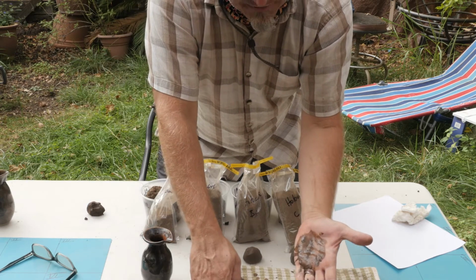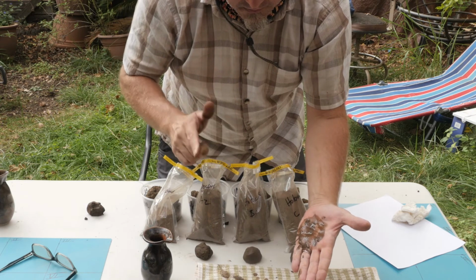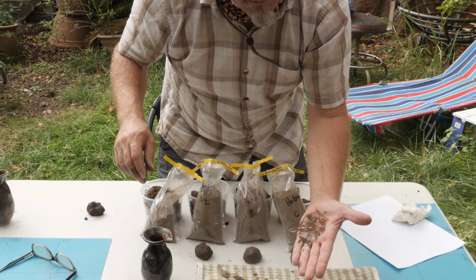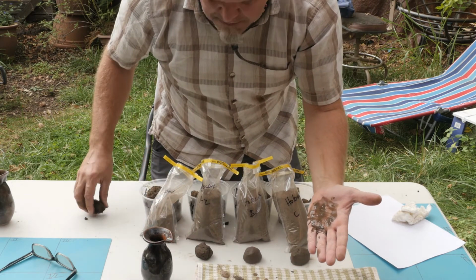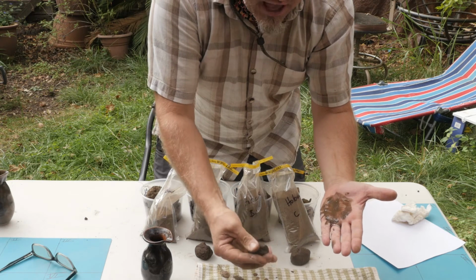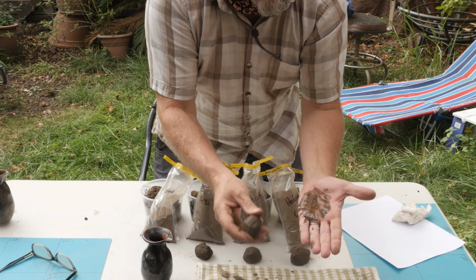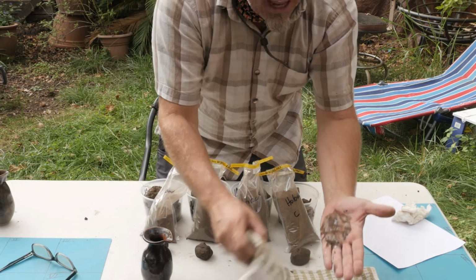Our next and final classification would be neither grittiness nor smoothness predominates. I think that's fair. So that would bring us to a clay loam. Wow. That might be a little bit finer textured, or a little bit more clay than is actually present in this case. But let's move on to the next one.